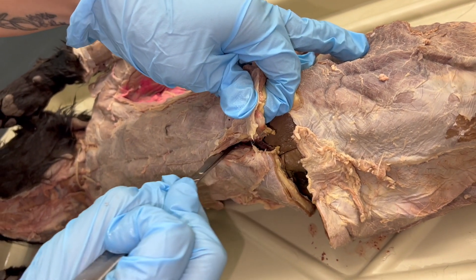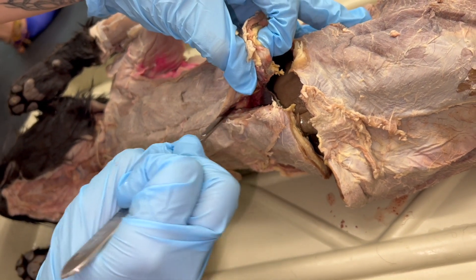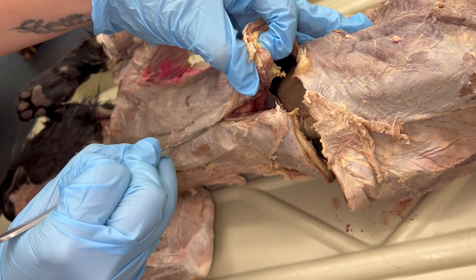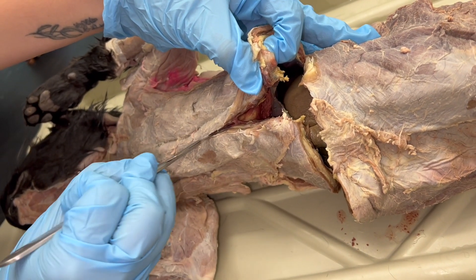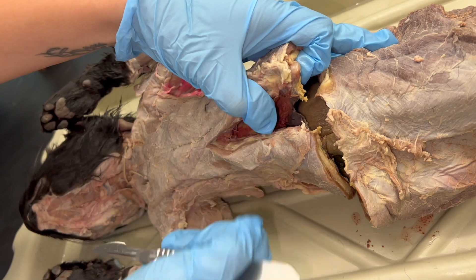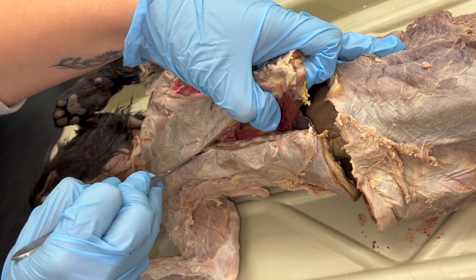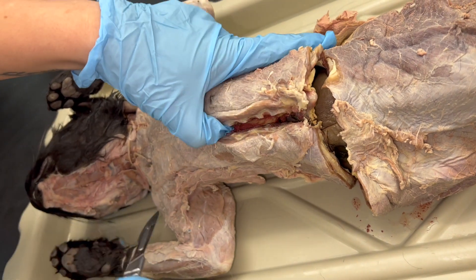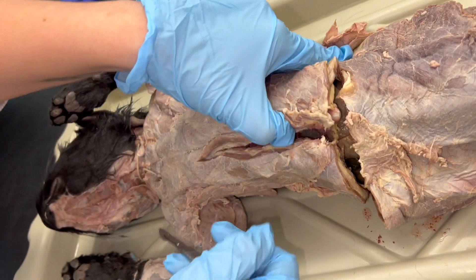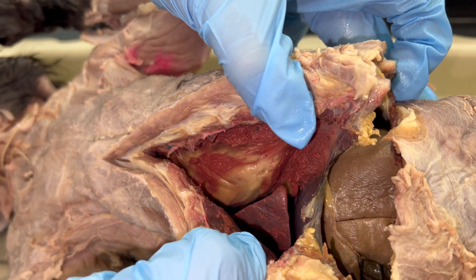You're keeping that same depth and aiming to where the cartilage of the ribs is joining with the sternum — just a little bit off center of the sternum. Keep going until it gets kind of tough and you're near the bottom of the pectoralis major.